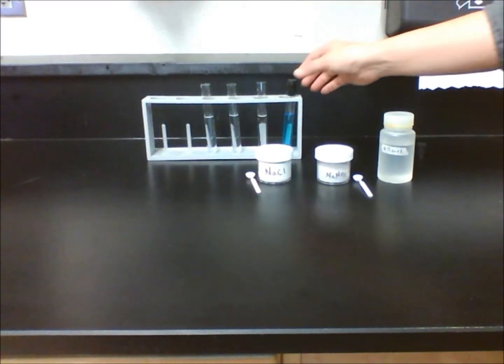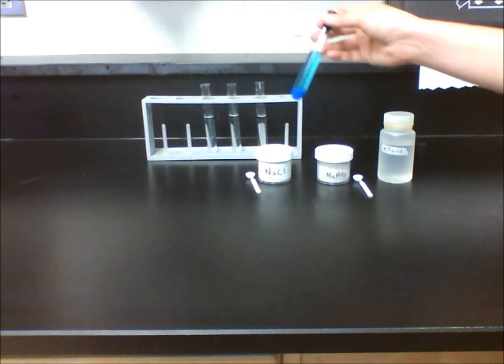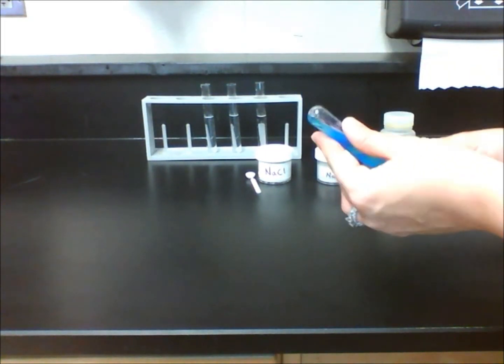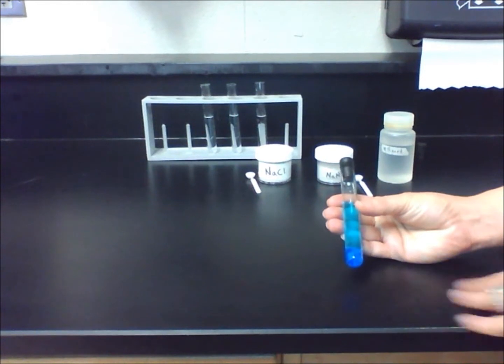In lab 13.1, students will examine the solubility of two different substances, sodium chloride and sodium nitrate, in equal amounts of solvent.